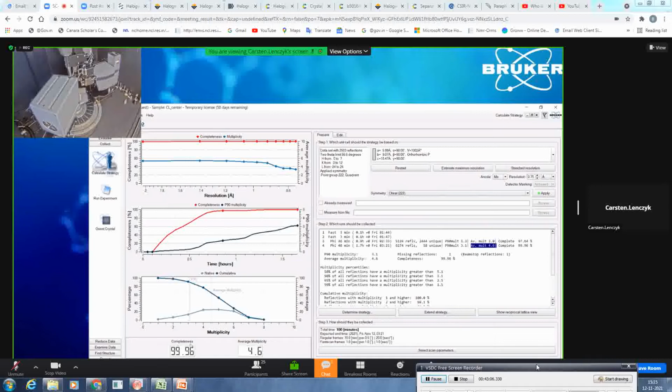Very important is, okay, why don't we have 100%? And you see here, there is one missing reflection, and always check, okay, this reflection is in the beam stop region. So you will not get it, independent of how much you try to recalculate the strategy.